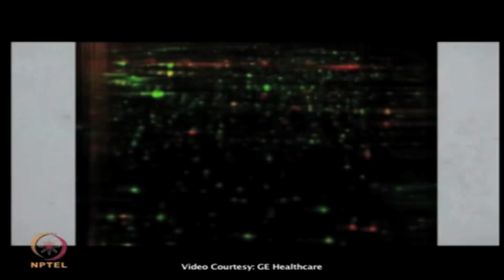The result from this 2D gel shows high resolution of membrane proteins in the sample, even if there are some known restrictions for hydrophobic proteins to be detected in a 2D gel. The results show many new cell surface label spots, shown here in red, that are not detected using the standard labeling protocol, shown here in green.